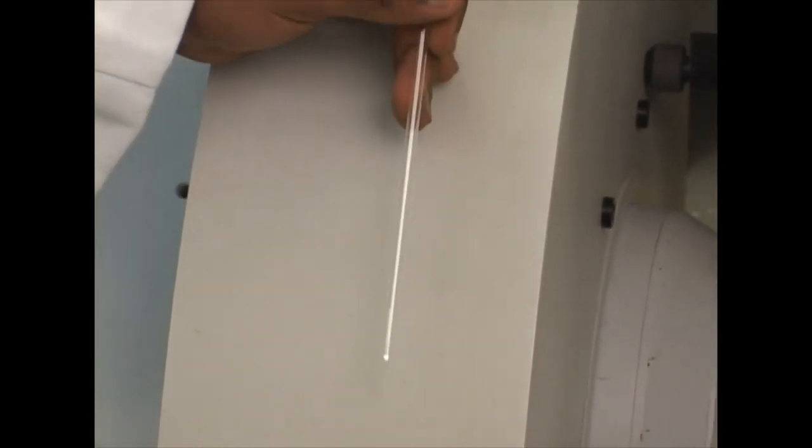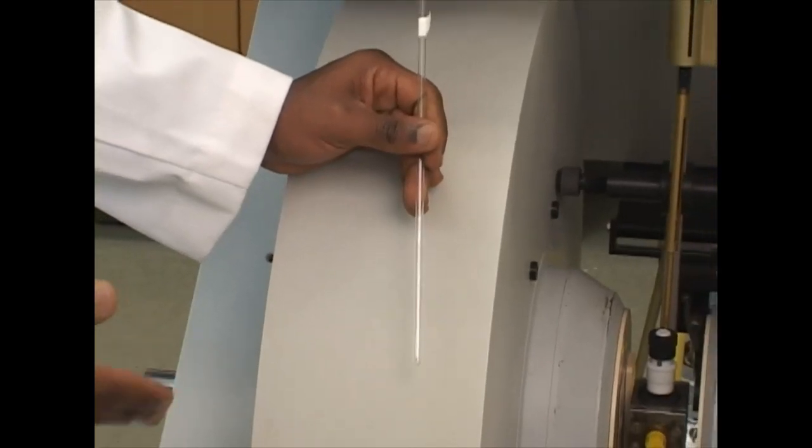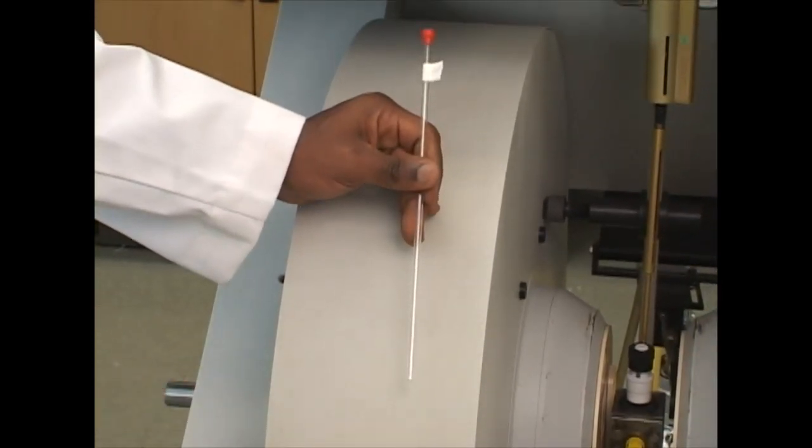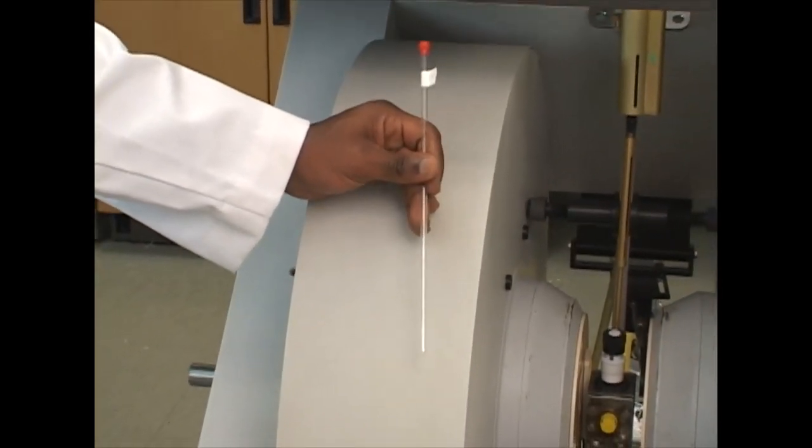The sample at the bottom of the tube was manufactured specifically for ESR testing. It's a nickel nanorod sample that we're going to run in our ESR.